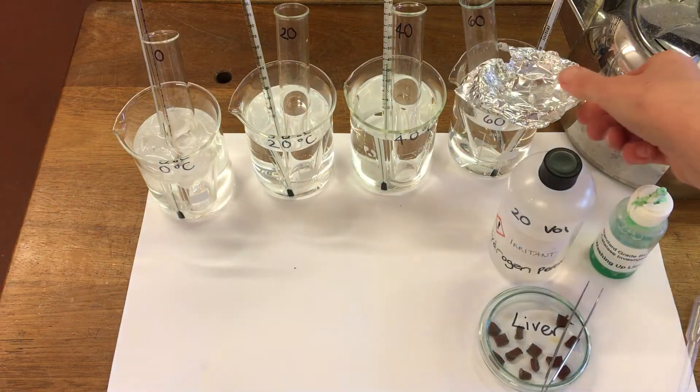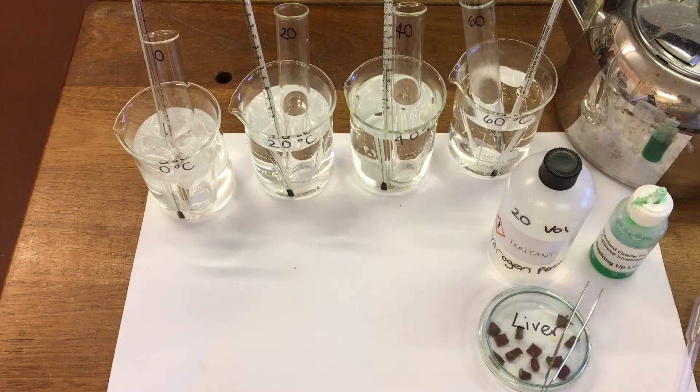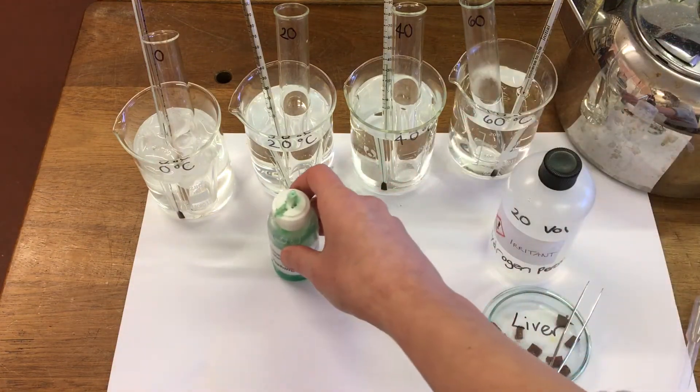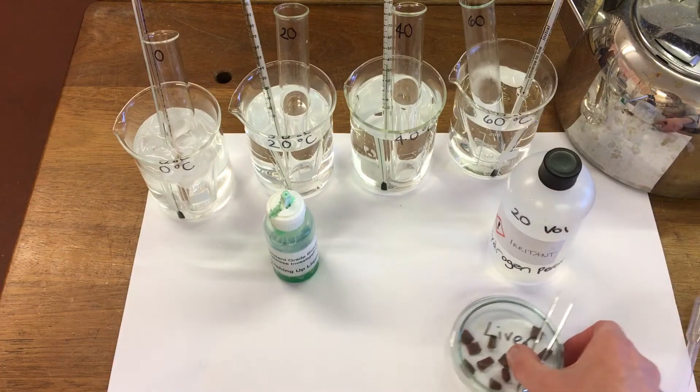We'll leave our solutions to get to temperature and then we're going to add a drop of detergent into each one and we're going to add a piece of our liver.